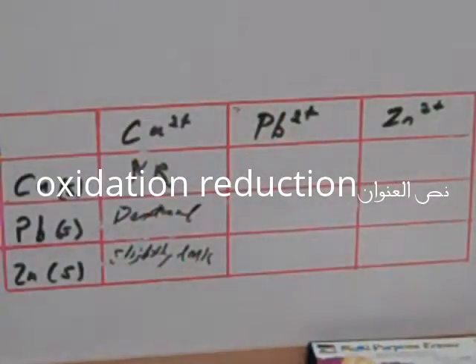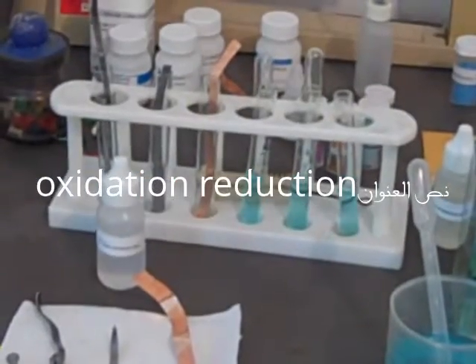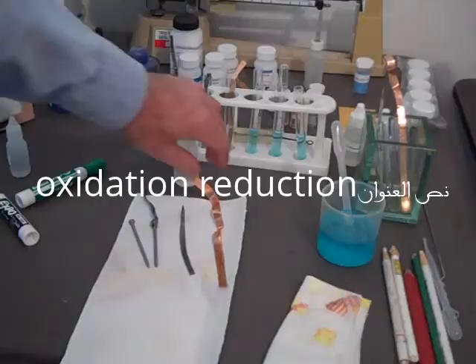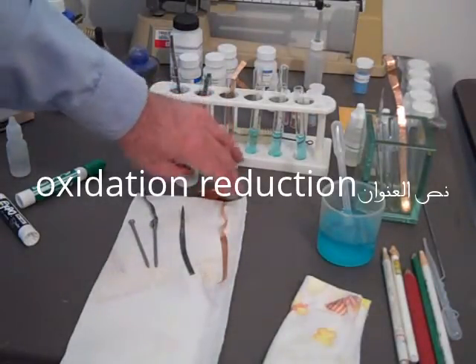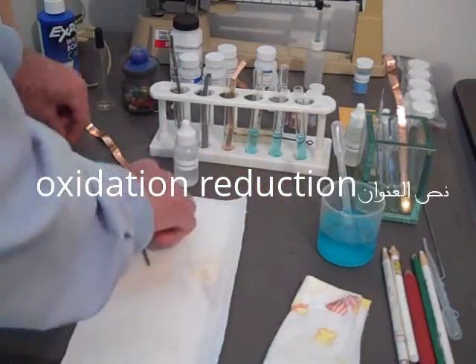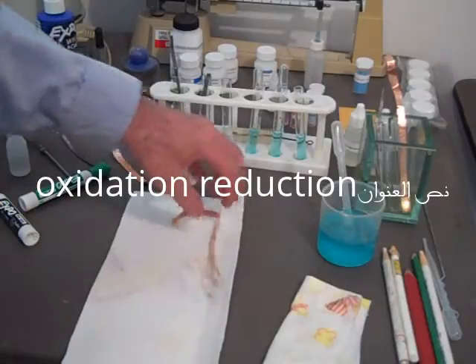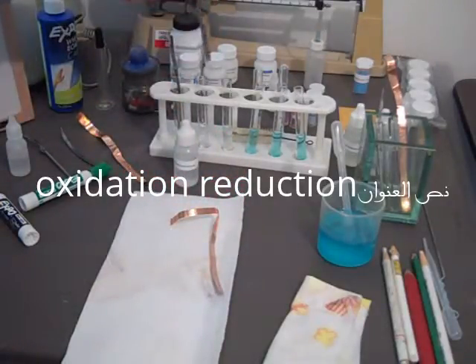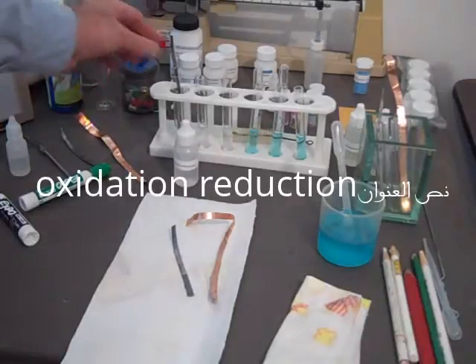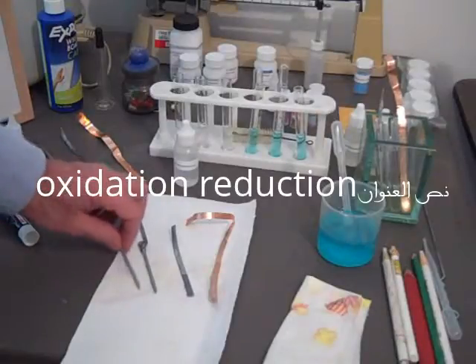Let's put these away. Pull out the copper from the lead nitrate. Again, nothing really—didn't expect that. And again, a lot of—we shouldn't have had anything here, the lead nitrate, because that's lead, it shouldn't have reacted. But the zinc should have, and it's very slight. So we have an oddity. We have an oddity. The way the results in—we'll try to figure out why that happened later.